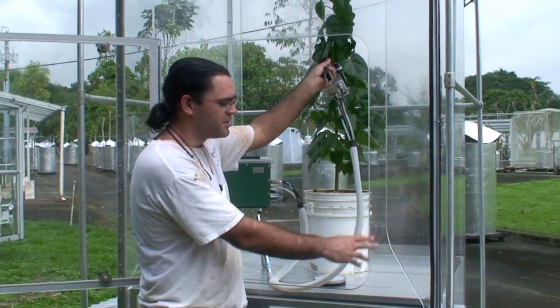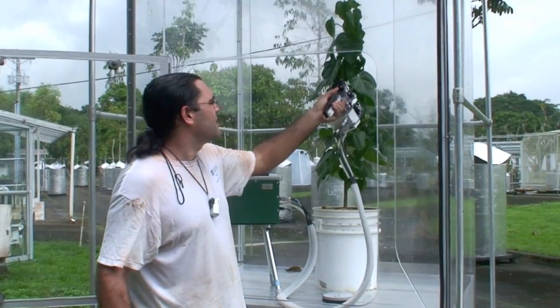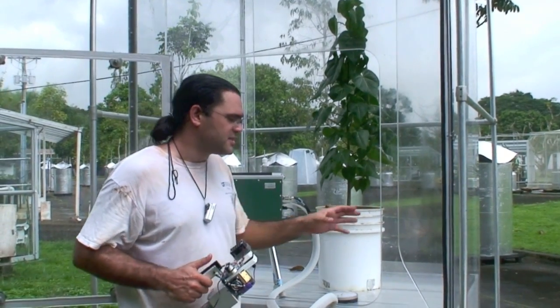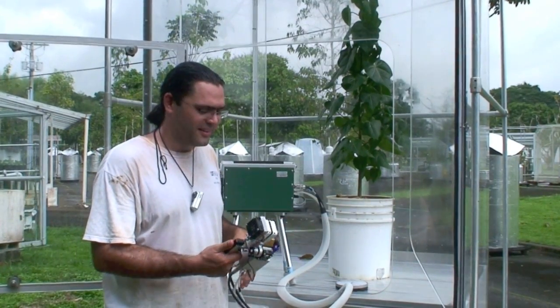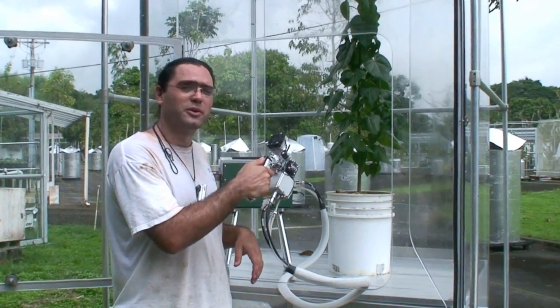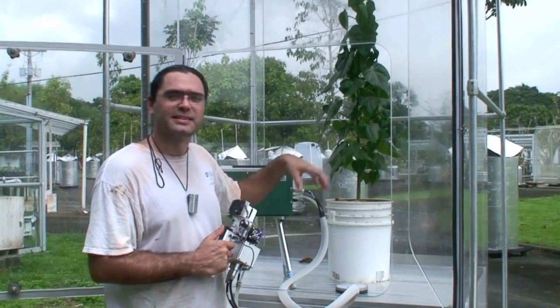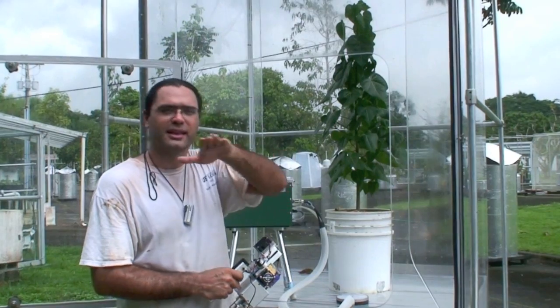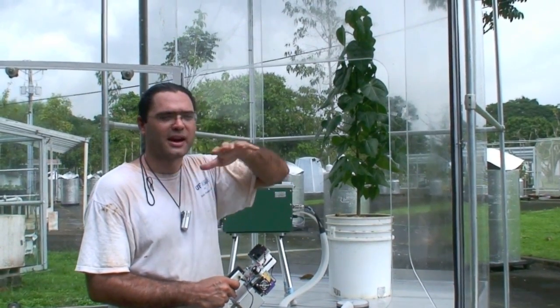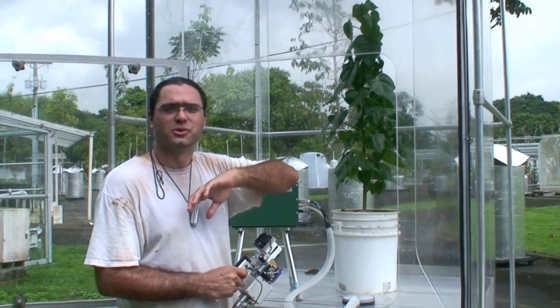This chamber allows us to manipulate temperatures. What we can do is change the temperature of the whole plant, maintain the temperature within this chamber at a certain level, and then measure photosynthesis — the rate at which CO2 is being taken up by that leaf under that temperature. We can then change the temperature of the chamber and do it again. By getting a range of temperatures, we're able to monitor how photosynthetic rates may change over the course of a day or over the course of a year.